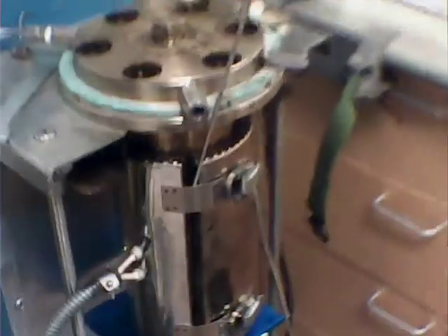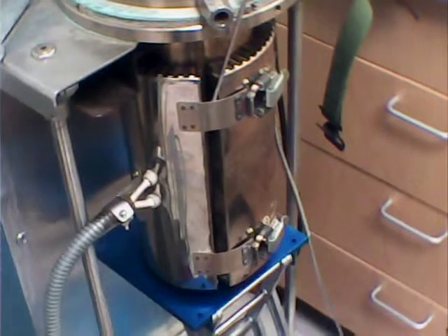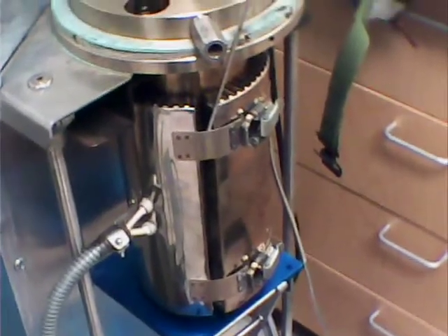So we're testing out — just heating it up. It's not under pressure, it's an open system in the autoclave, and he's got it hooked up to the temperature controller.